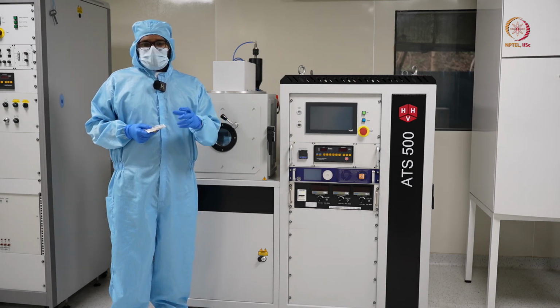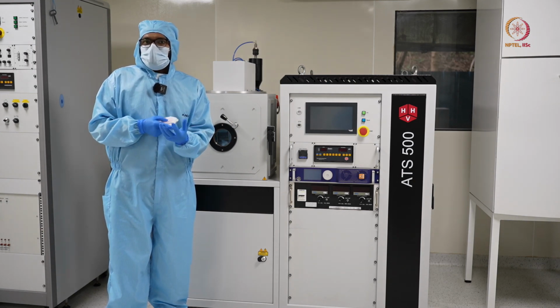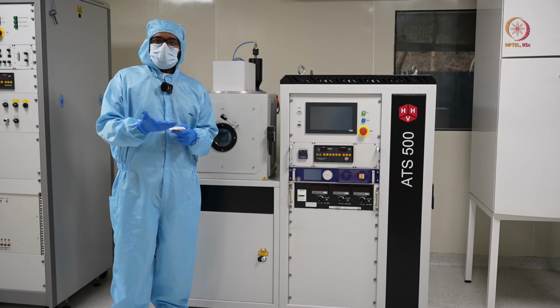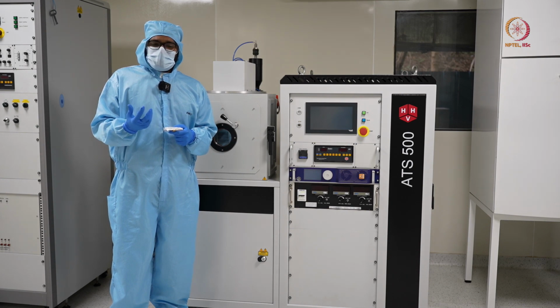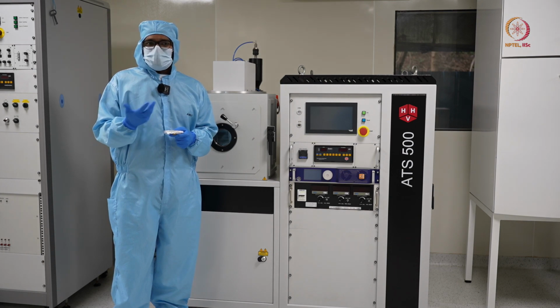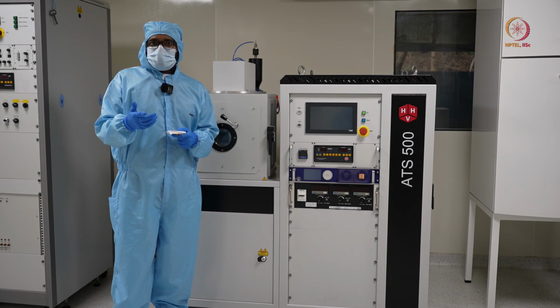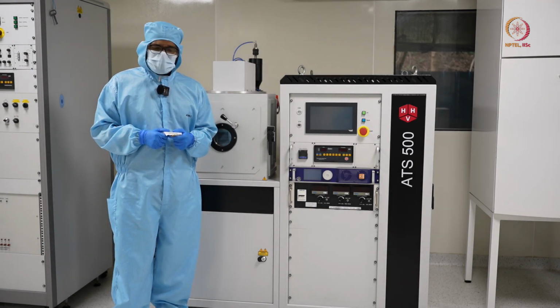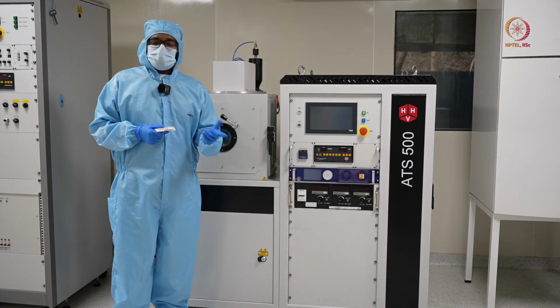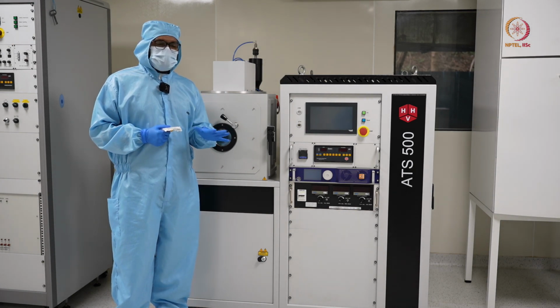Also, when you are melting a material, you need to contain it in some crucible, and that crucible should not melt off along with it. So when you are talking about materials like aluminium, gold and titanium, you can place them in a boat of tungsten, which has a very high melting point, and that is the reason it is used as a filament in certain cases. But what if you want to deposit a material like tungsten, which has a high melting point? It is practically impossible. So in that case we move to sputtering.